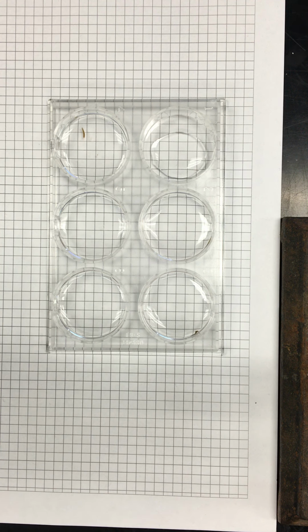Those concentrations were... So that's a 1 to 10 dilution. So what you should be doing is like 9 parts in 1, whatever. Yeah, this one is going to be 2.4, they made it so, and then it's going to be 9.6 in order to make 12.